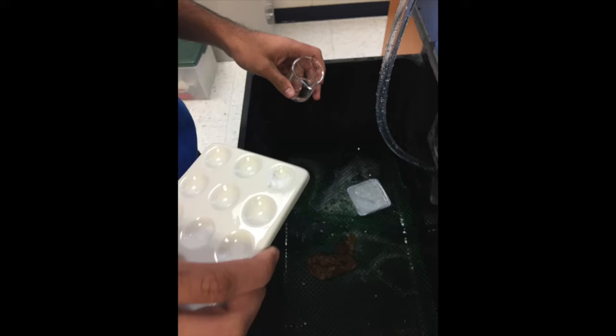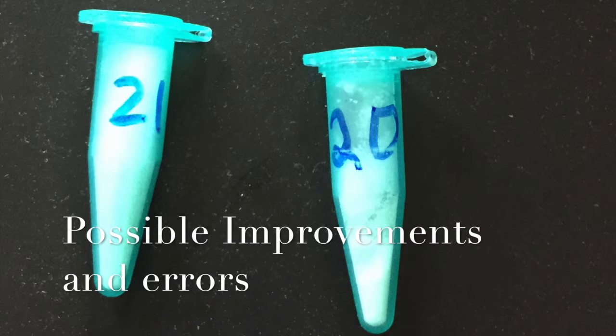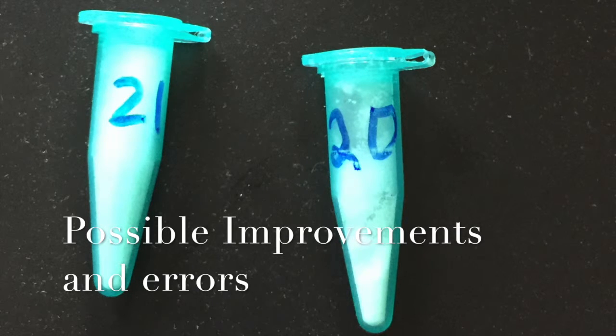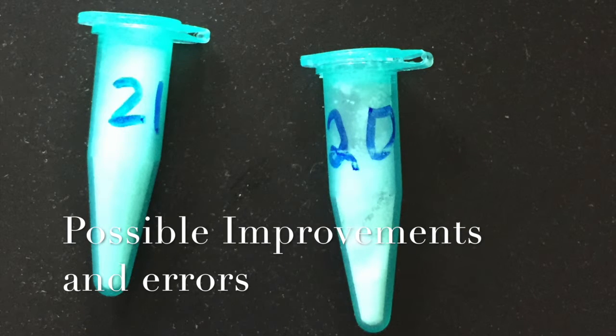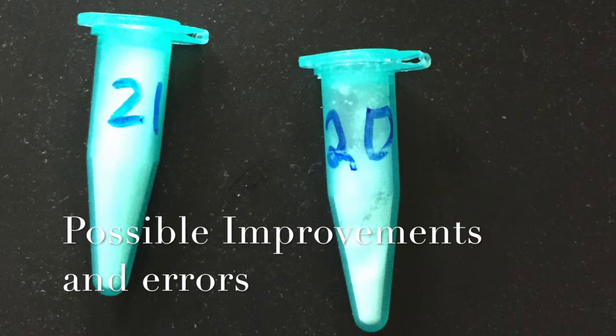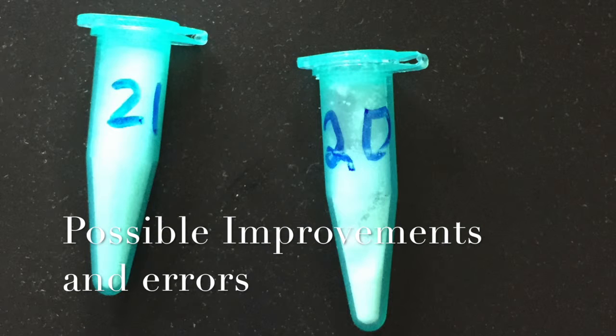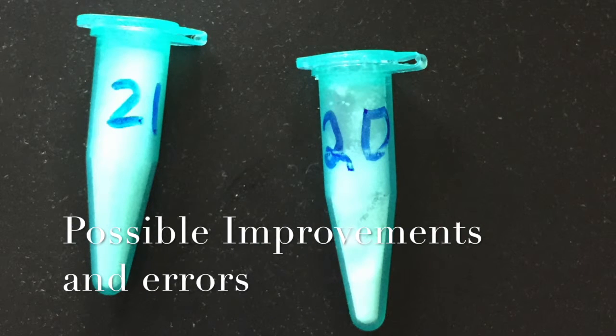What the group could have done to improve the unknown process. Determining the unknown process could have been a lot easier if some slight tweaks were made during the test. These particular tweaks involve differences in the odor test. The odor test could have yielded slightly different results that would have been more helpful to the group as a whole if the unknown substances were wafted after they were dissolved in water.